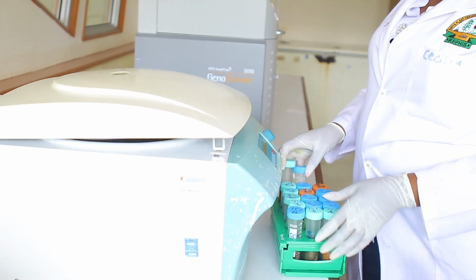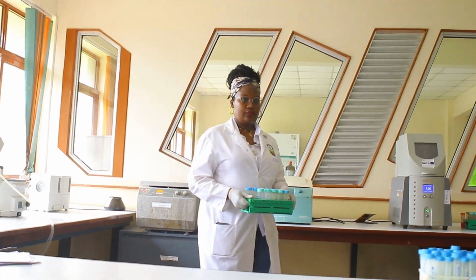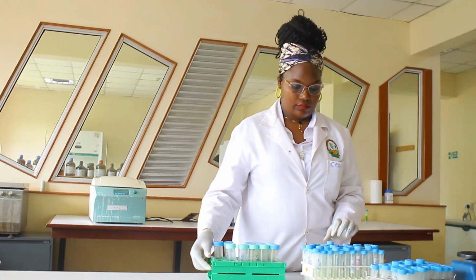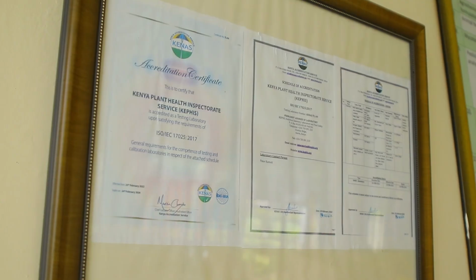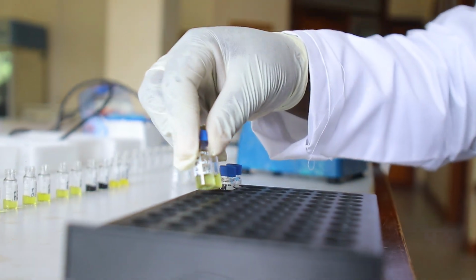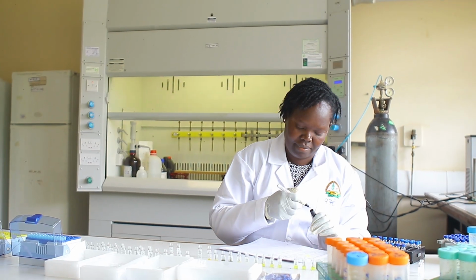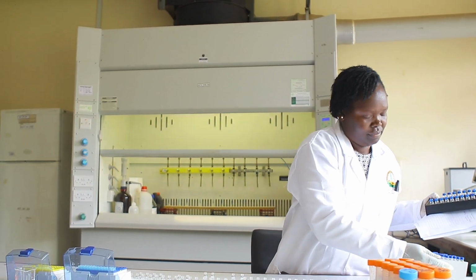The ultimate goal for us as a testing lab is to ensure that we give our clients results that are valid, credible, and unquestionable. And therefore, as a testing lab, we have been accredited for the last 19 years to the ISO 17025. This standard gives us the requirements for the competency of a testing lab. So we have implemented those requirements. We have been checked by a third party to ensure that we're implementing these requirements of this standard, and therefore we have been deemed competent in various scopes.